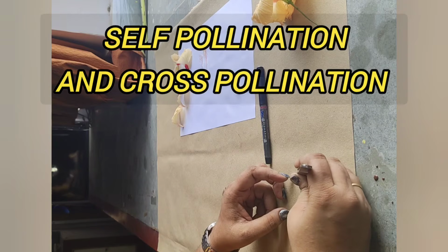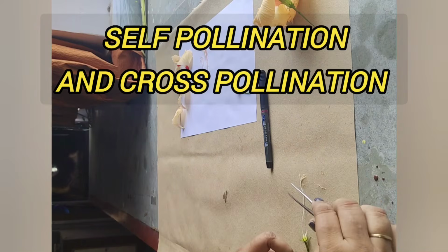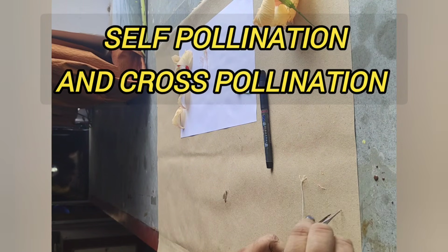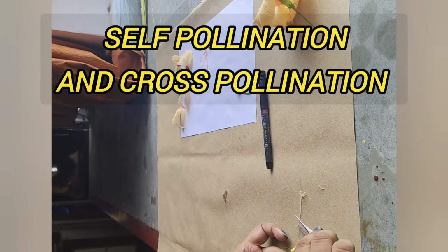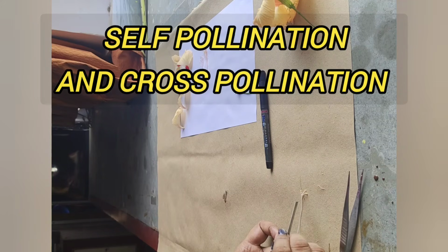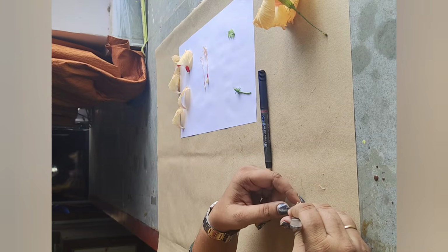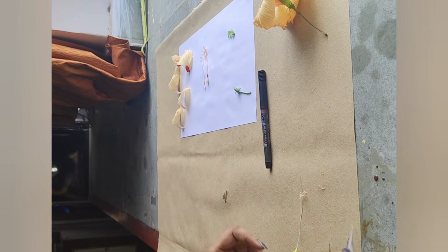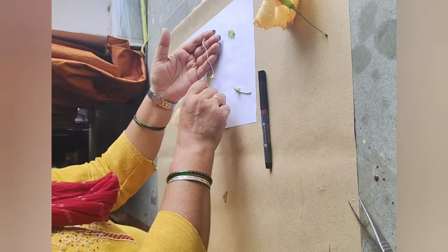Now, as we can see, the hibiscus flower has both the male and the female parts, so both self and cross pollination occur in this plant. Self pollination means transfer of pollen from the anther to the stigma of the same flower or to another flower of the same plant, whereas cross pollination means transfer of pollen from the anther to the stigma of another flower of a different plant of the same species.